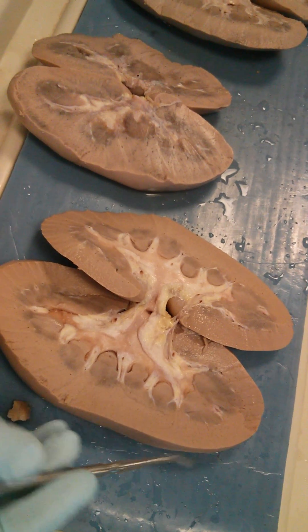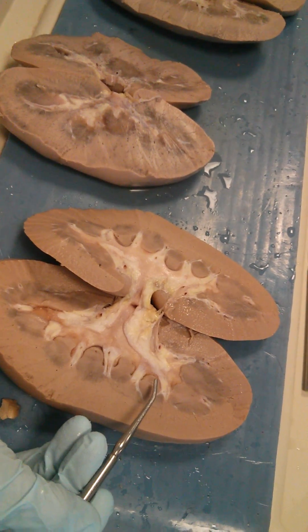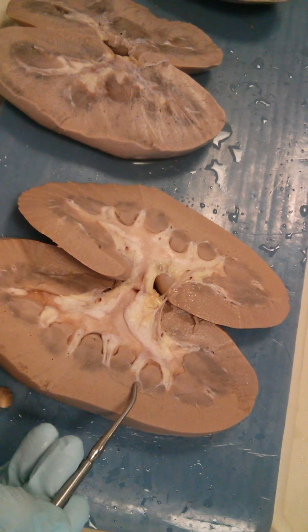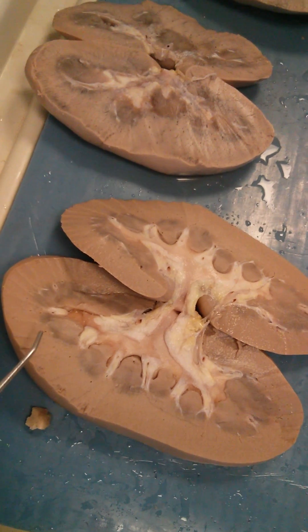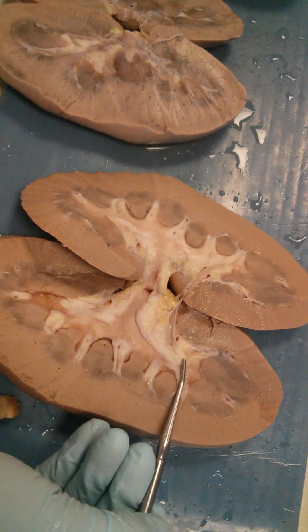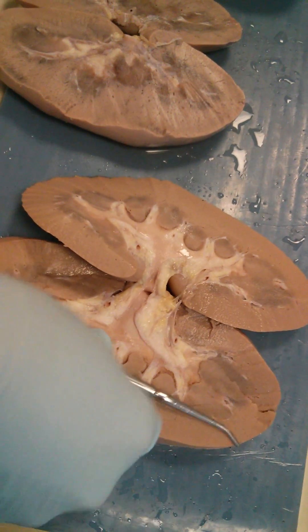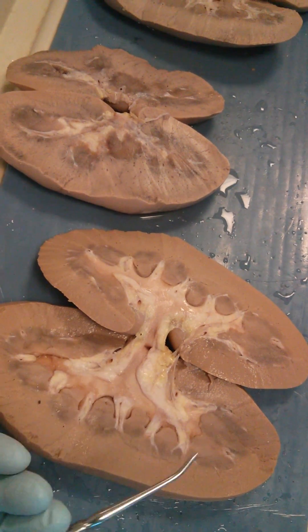This is the renal pyramid — base and tip, base and tip, base and tip. What is between the pyramids is the renal column. Between the pyramids you have the renal column. The outer part is the cortex and the remainder is the medulla. As mentioned, we talk about structures in the medulla but we don't say 'medulla' — the medulla has hundreds of structures.